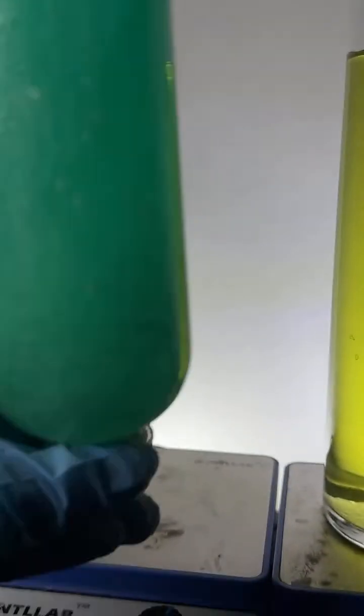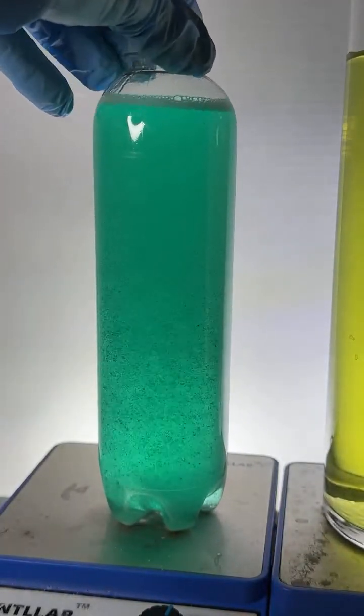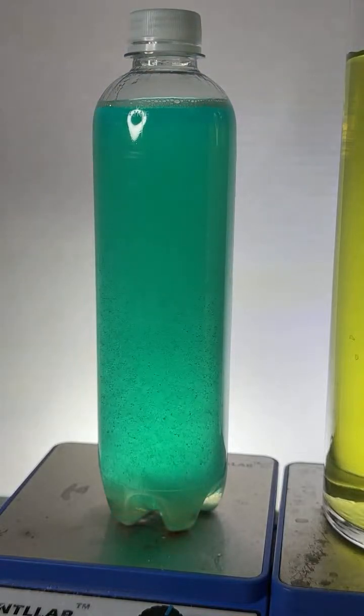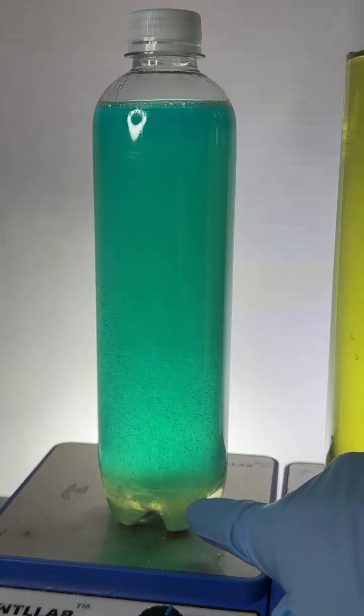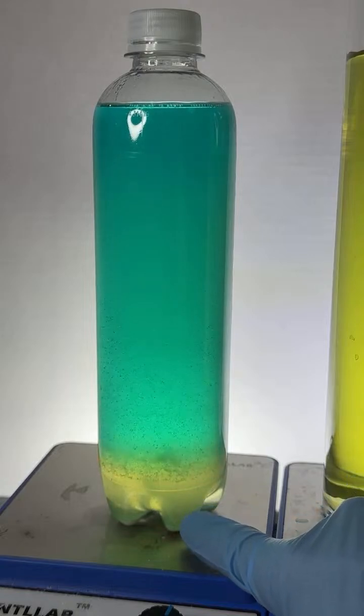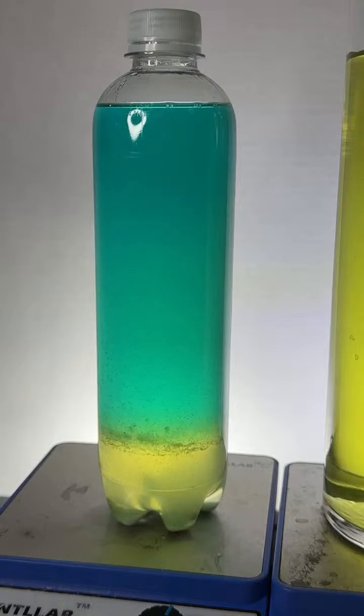Sometimes, there we go. Come on, baby. Let's see if I can get the good separation. So once again, there was a mixture of water and alcohol in here. To that mixture of water and alcohol, I added some dyes, and I added a white solid. That white solid dissolves so well in the water, and there's such a strong attraction that the water and the salt will come together and push the alcohol out. And it turns out the yellow dye dissolves better in the saltwater layer, and the blue dye dissolves better in the alcohol layer. We're seeing it good now.